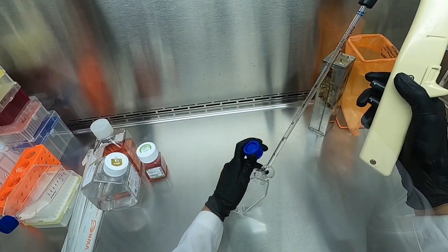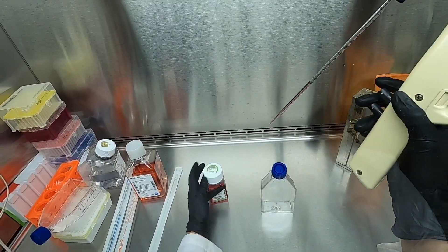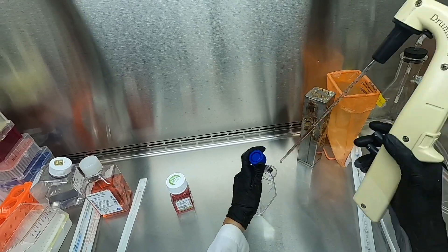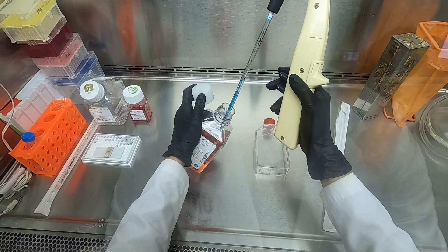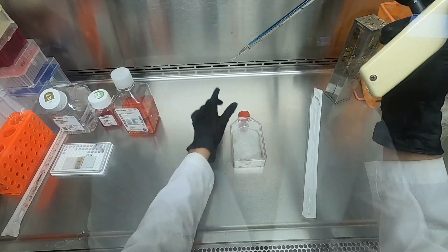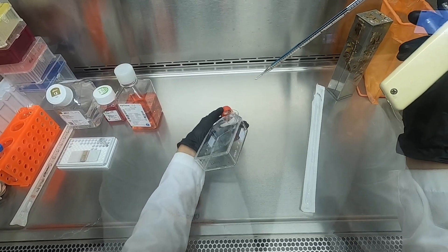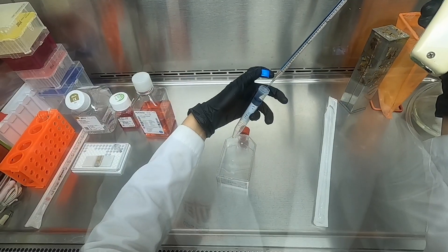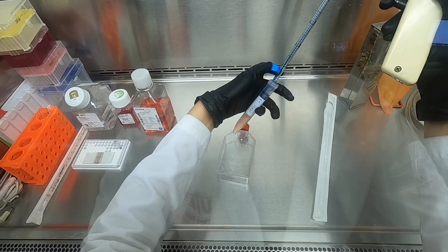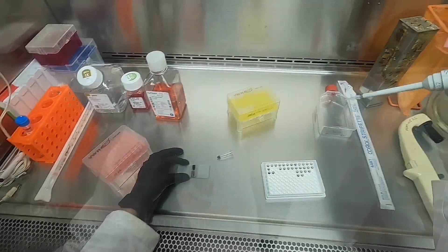We first rinse the excess FBS and media from our flasks. We then proceed to trypsinize our cells in order to detach them from our flasks. Then we inactivate the trypsin using complete media containing FBS, making sure that we achieve a single cell suspension. Finally, we count our cells using the trypan blue exclusion method as described in our previous video.